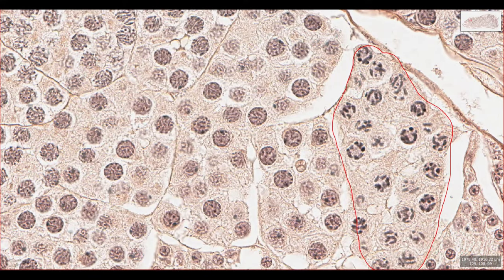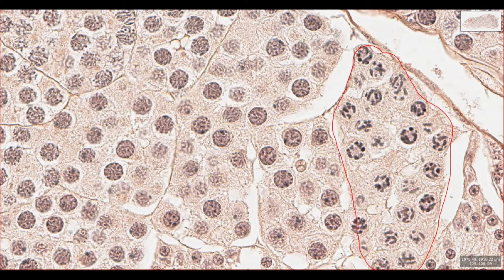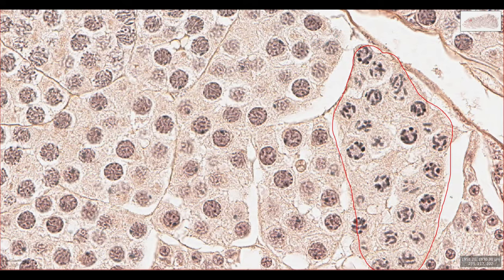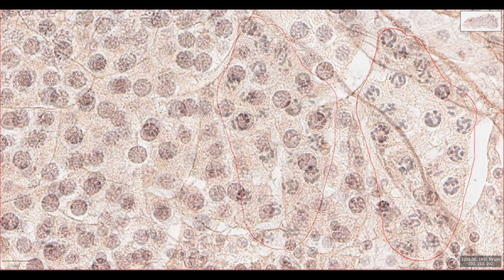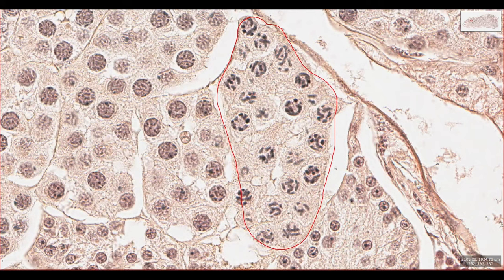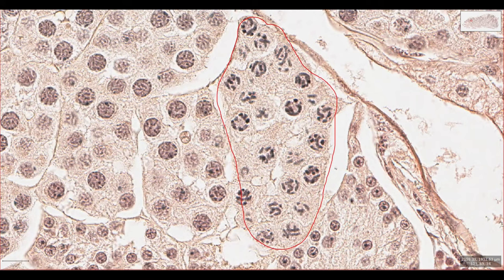Chromatin refers to this DNA-protein complex which forms chromosomes. In general, more active cells or dividing cells will have larger nuclei with more dispersed chromatin, such as these spermatocytes. The DNA in spermatogonia is being replicated in preparation for cell division, so we can see the chromatin much more clearly as it's unwound and the DNA is replicated. With all of this DNA replication there's probably more chromatin in these cells, further increasing the size of the nucleus. Sometimes we can see the chromatin forming chromosomes as much more discernible individual structures.